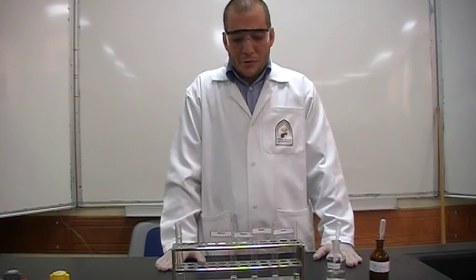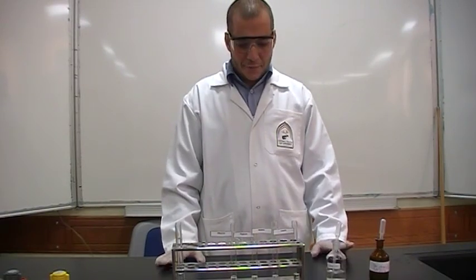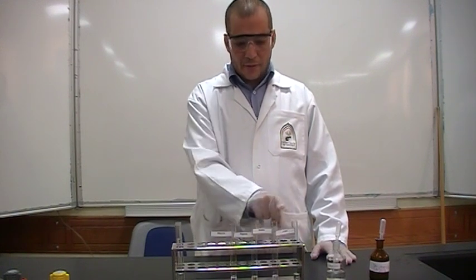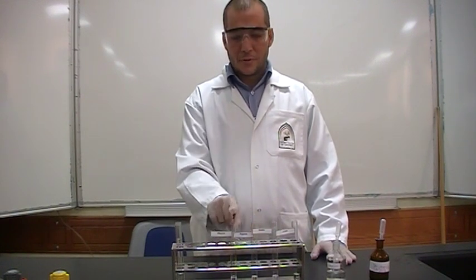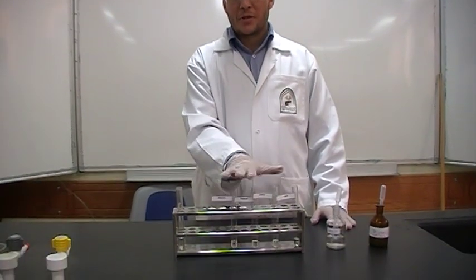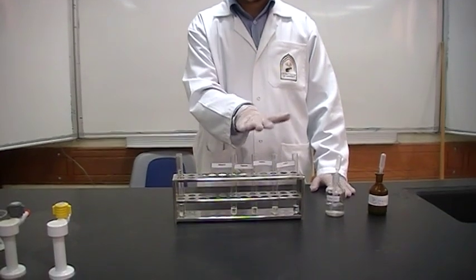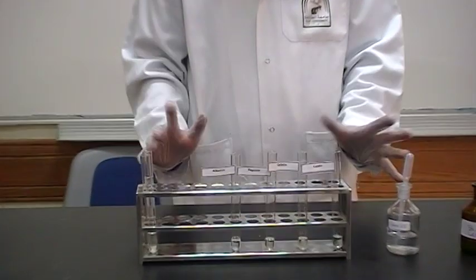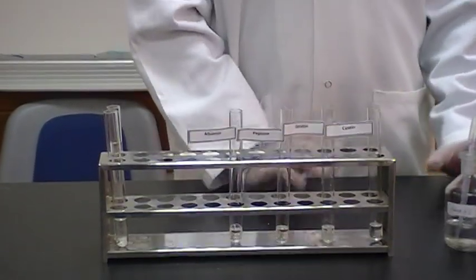So let's do the experiment of biuret. In this case, as we said, we have four proteins, which is casein, gelatin, peptone, and albumin, which expects them to give positive results with biuret, violet color, and here amino acids, which is expected to get blue color. So what shall we do?